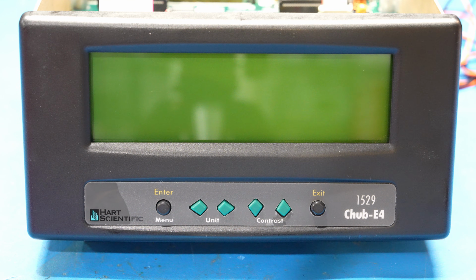Well, some time has passed since the last segment recording of this video. If you recall, I did put a new CPU in there and I verified that there was some activity on the line, which was great. I erased the EEPROM with the UV light, reprogrammed it back again, everything was looking good, and in fact the instrument was booting. But then when I completely put it back together, it wasn't working again. It would kind of boot up and then it would fade away.